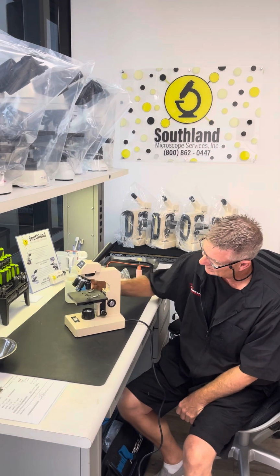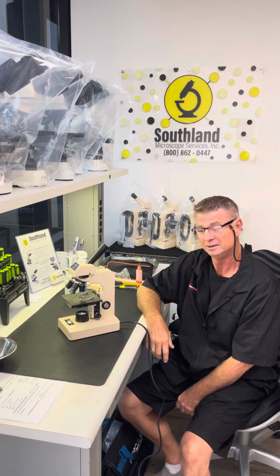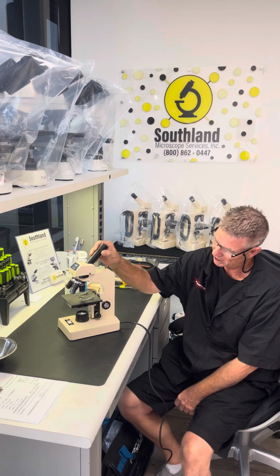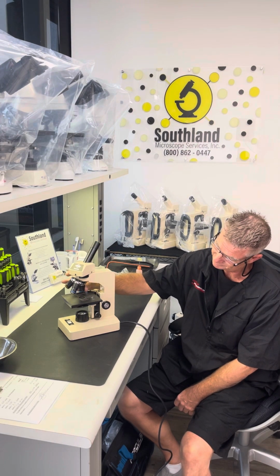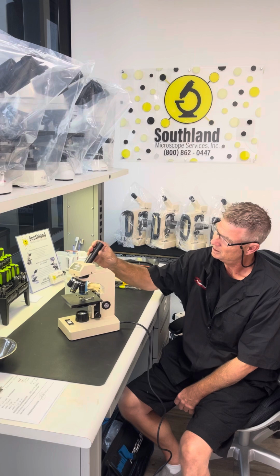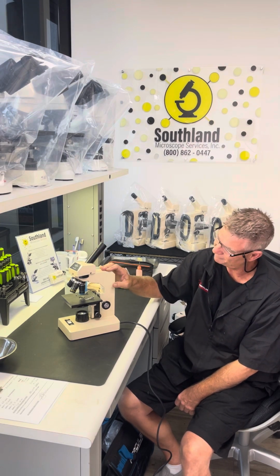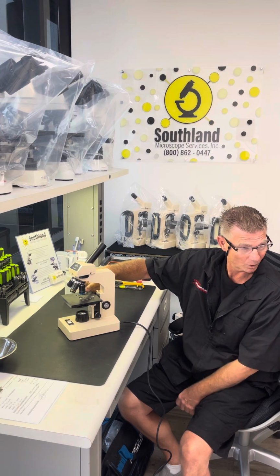The scope we're looking at here is a Swift M2251 corded microscope. It's a monocular with three objectives: 4 times, 10 times, 40 times. This has a 10-time eyepiece. This microscope magnifies at 10 times 40 is 400 times.